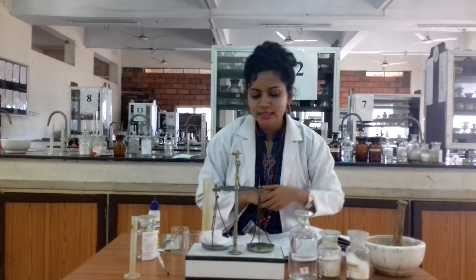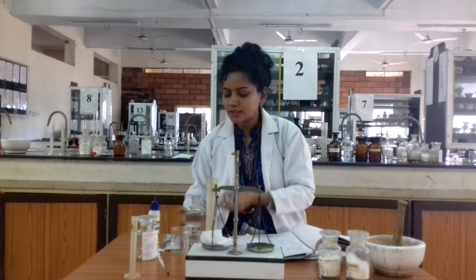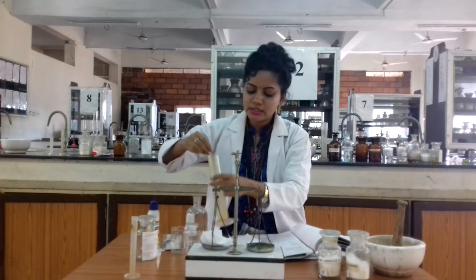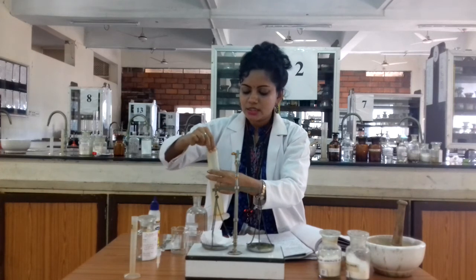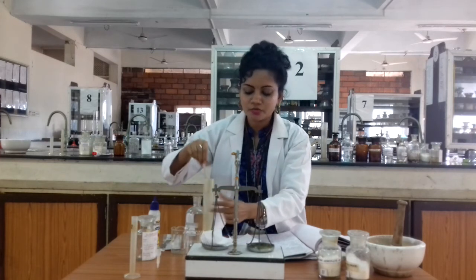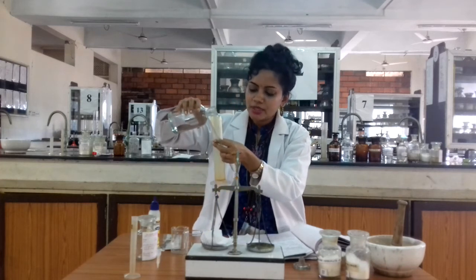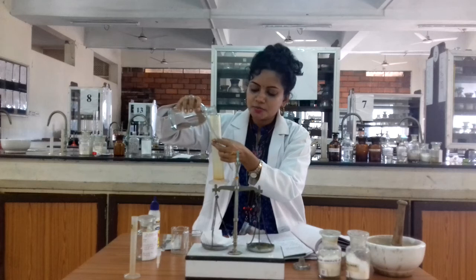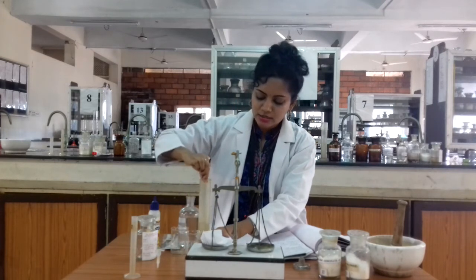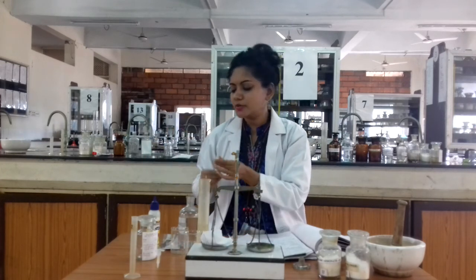The peppermint water acts as the vehicle. First, add a small quantity of peppermint water to the measuring cylinder, then mix with a glass rod. These are fine powders, so they are easily dissolvable. Add a small amount of vehicle first and mix well to dissolve the powders. This makes 50 mL of mouthwash.